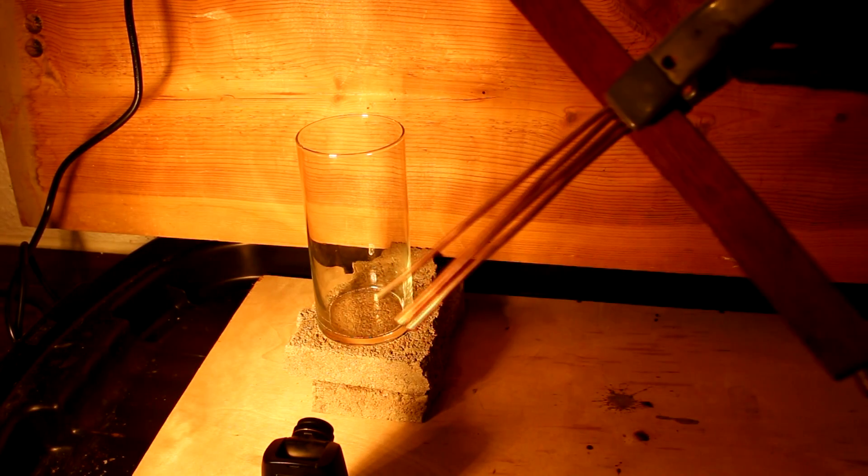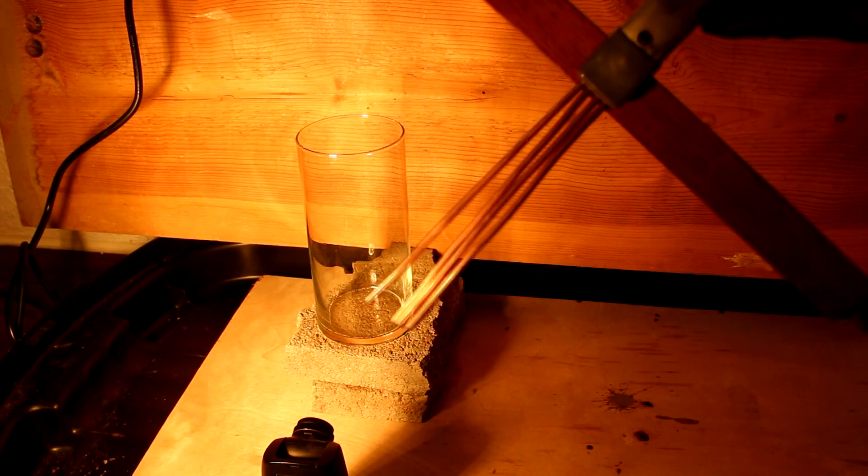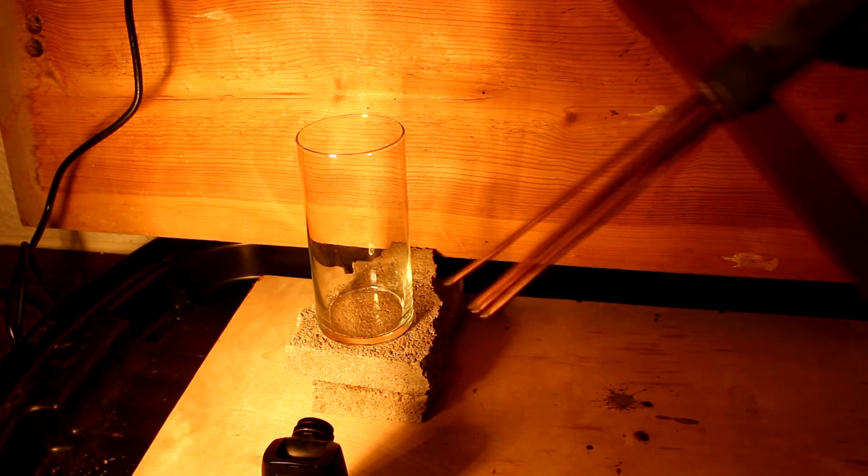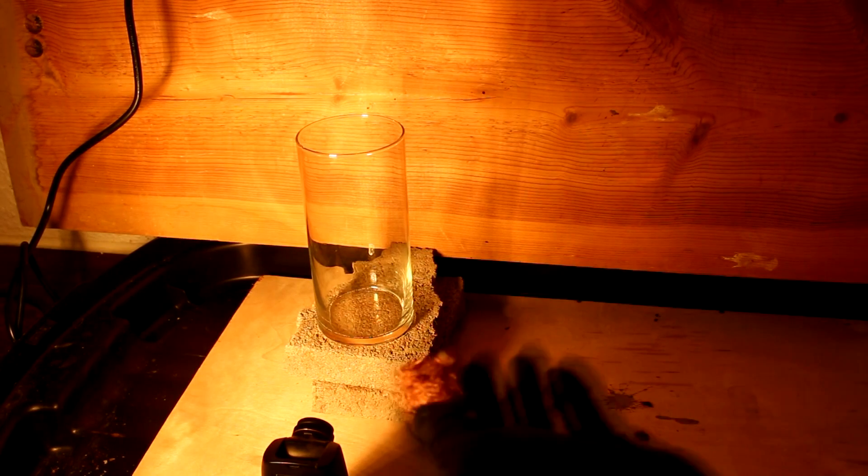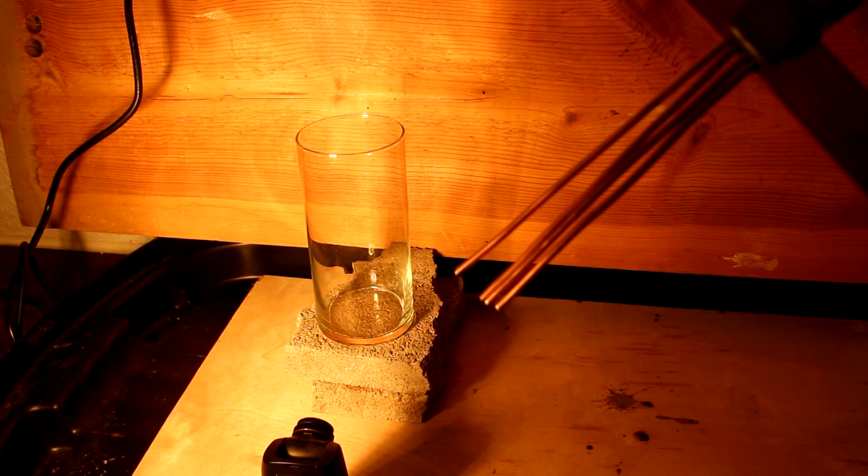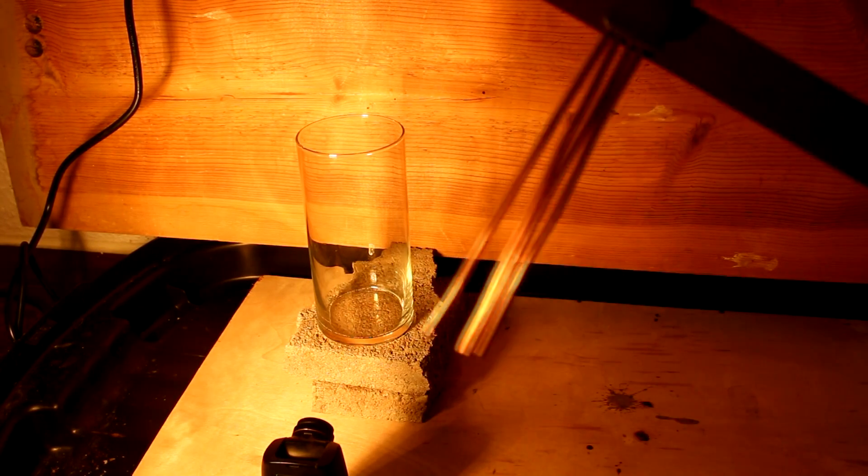This is what I'll be using for the reducing agent. Just some strips of thick copper wire. Now normally I would use a wad of bare copper scrap but like I've said this is a special occasion and I wanted this to look nice.